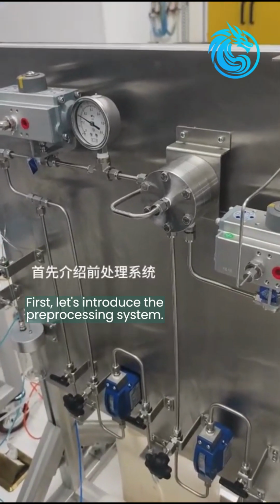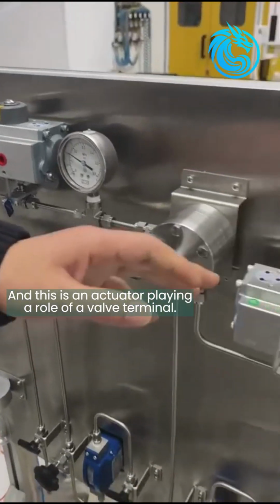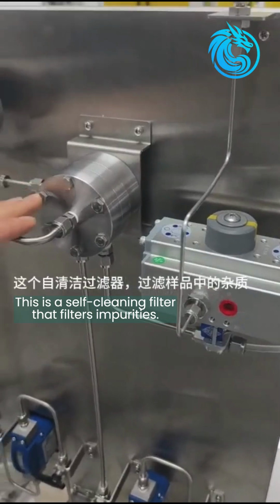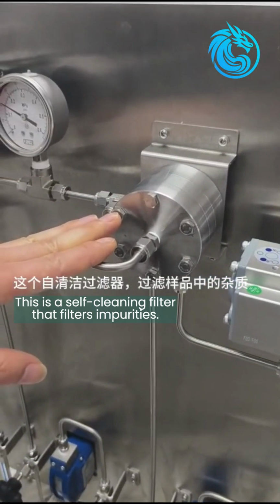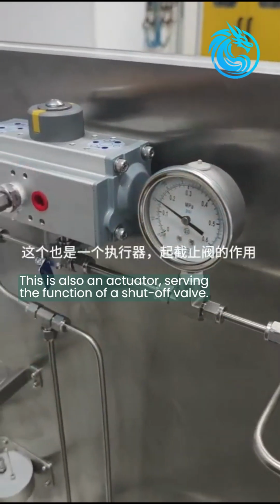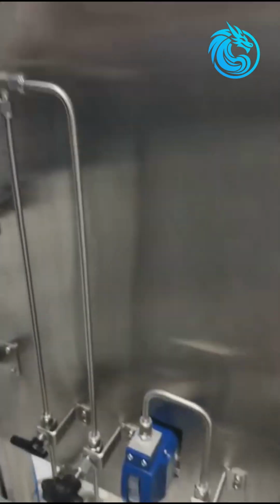First, let's introduce the preprocessing system. This is an actuator playing a role of a valve terminal. This is a self-cleaning filter that filters impurities. This is a pressure gauge, used to measure the pressure in the oil circuit. This is also an actuator, serving the function of a shut-off valve.